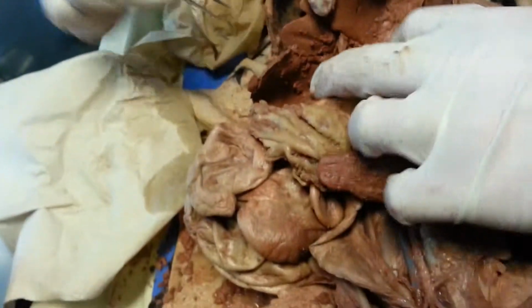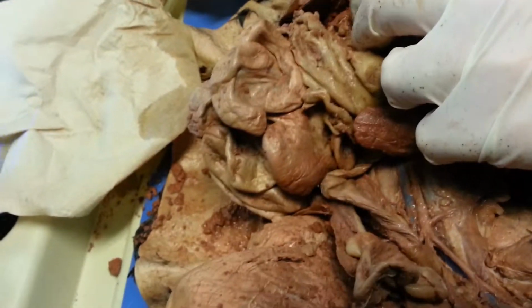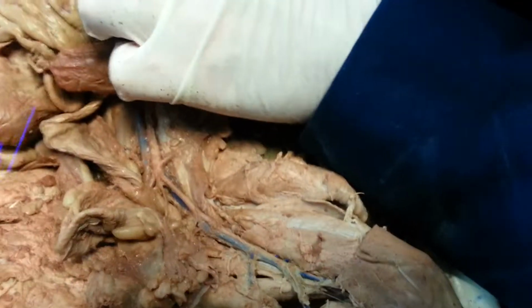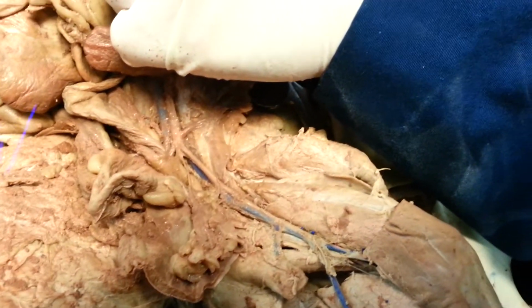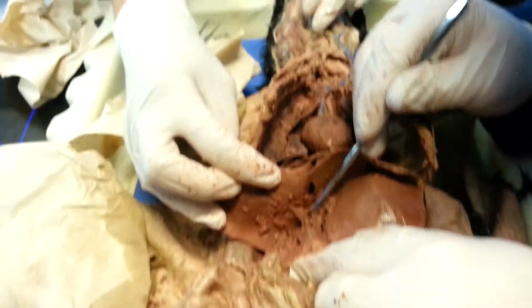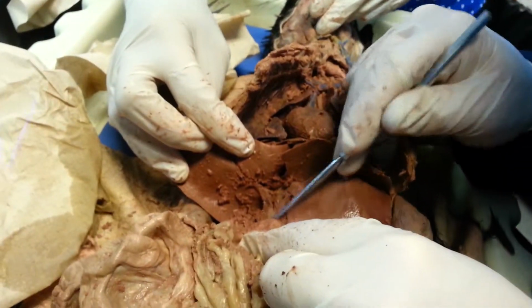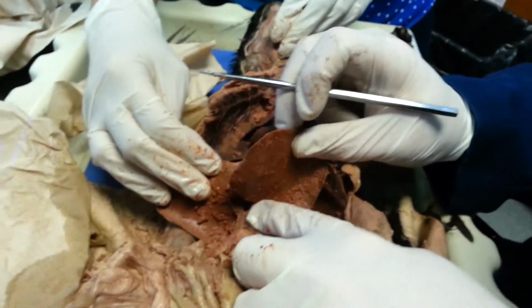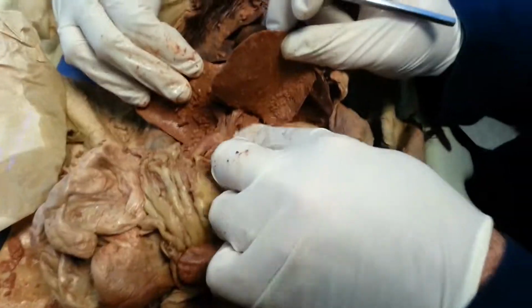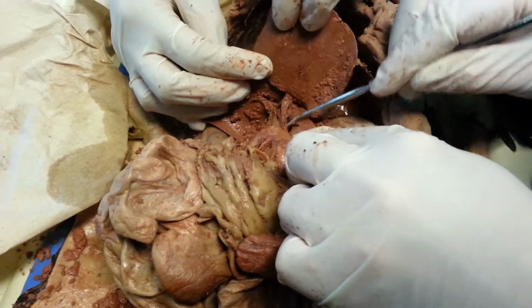Is it a membrane? Actually, let me see where you're pointing. Or is it your gallbladder? No, I lied, the gallbladder would be that way. I'm not sure what you got into there. If you point to something in there, it has to be hepatic something.